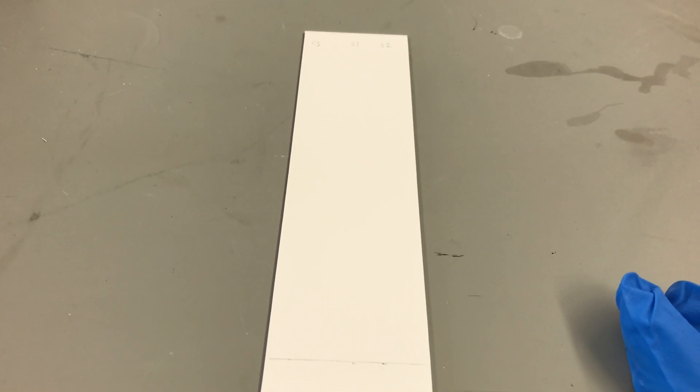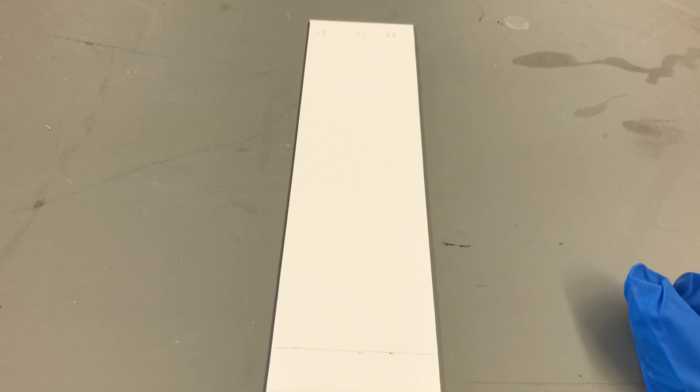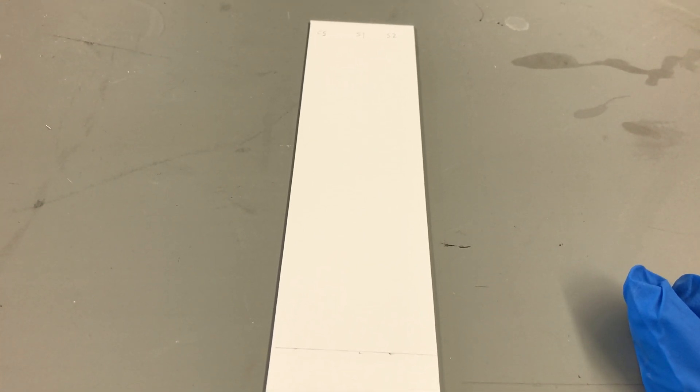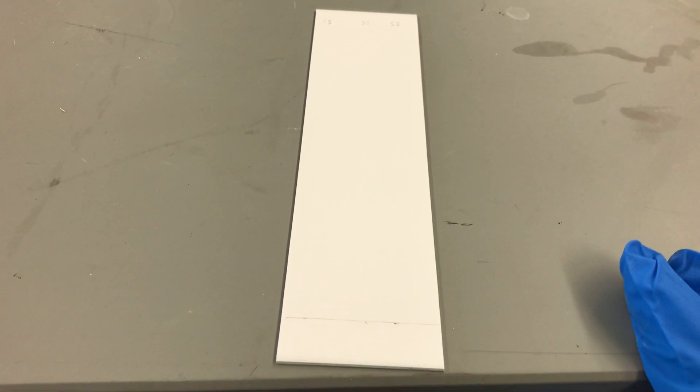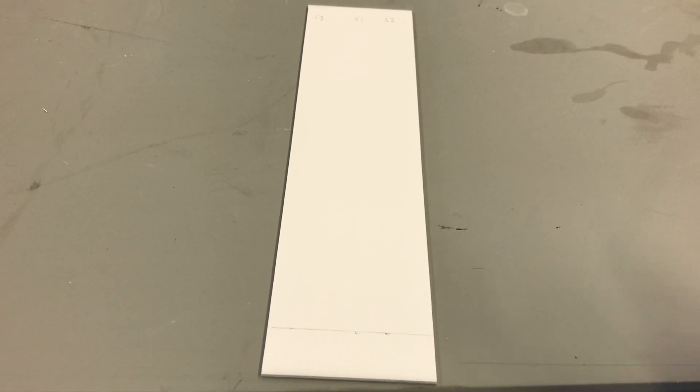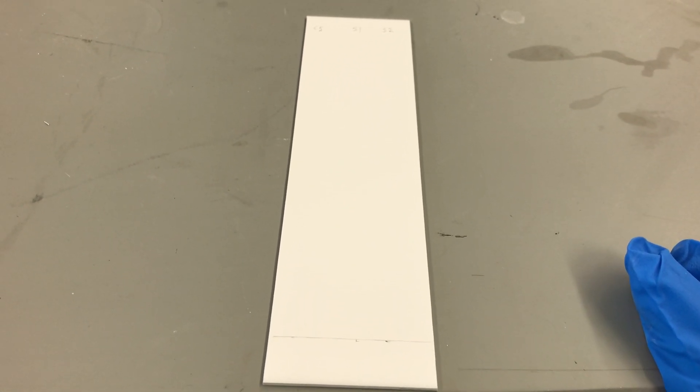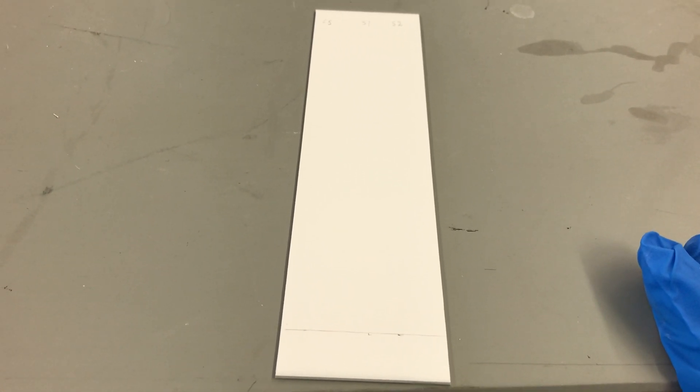These plates are very delicate. They are very easy to flake or chip the powder coating off, which will ruin your results. So when we prepare the chromatography plate, we have to be really careful. At the bottom of the plate, you can see I drew a line exactly one and a half centimeters up from the bottom—think of it as our start line.